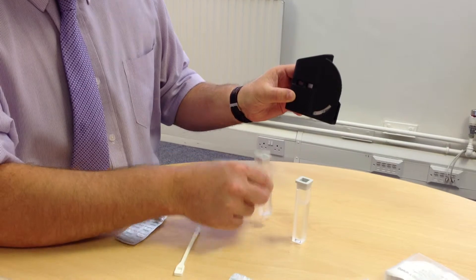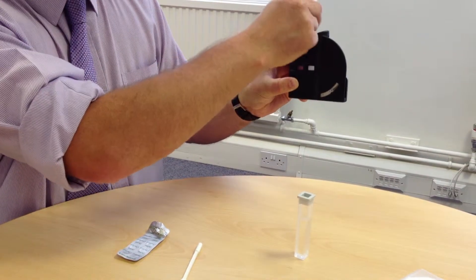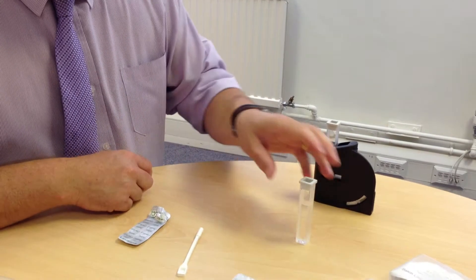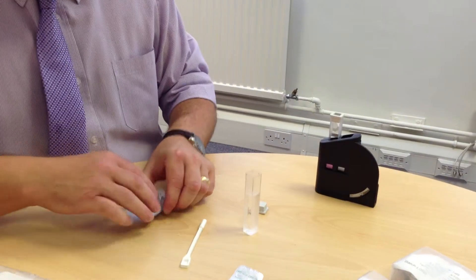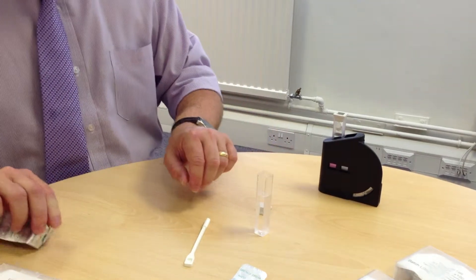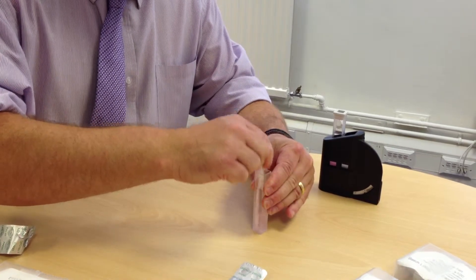The blank, which is just mains water, is put on the side of the colour like so. To the test cell we would add one tablet and using the tablet crusher supplied with the test kit we will crush the tablet.